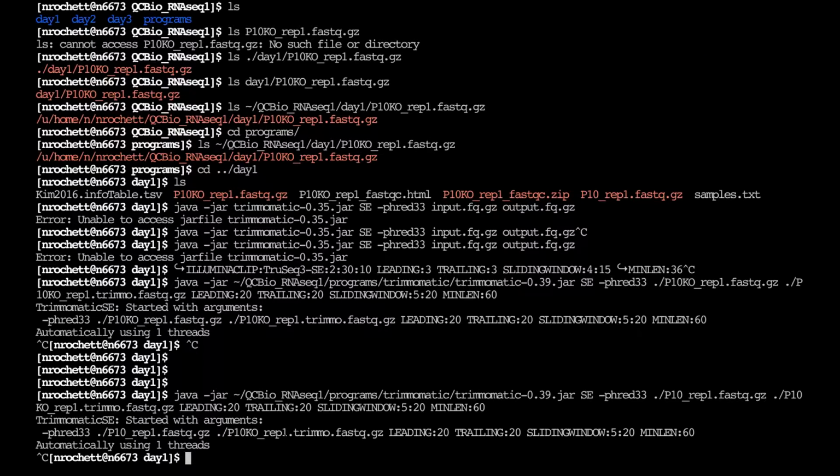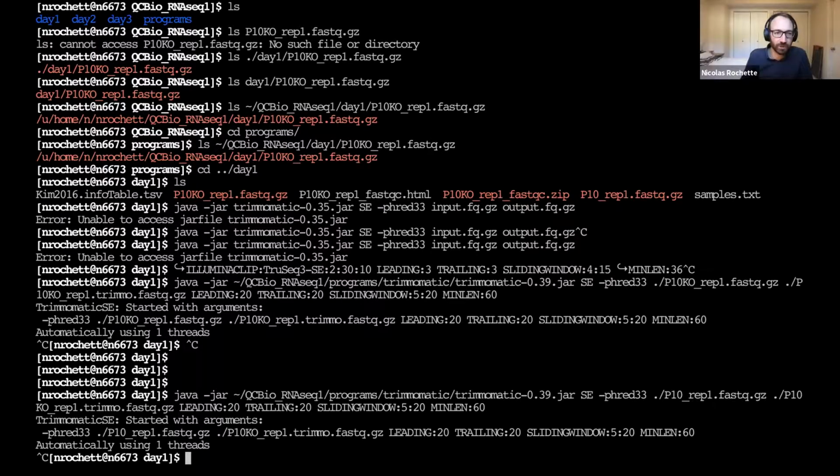I actually had two places to change, right? I changed the input file. I just took one of the names, and so I changed this. So it's actually working on the data from the second sample, but the output file is still that of the first sample.